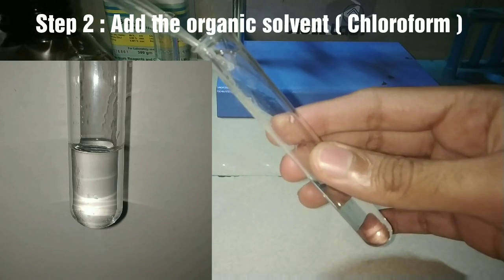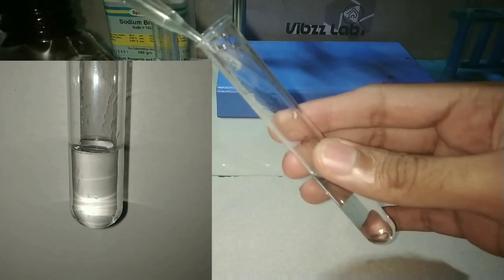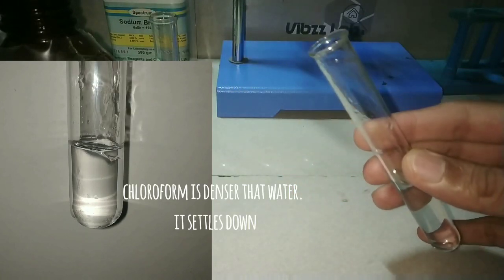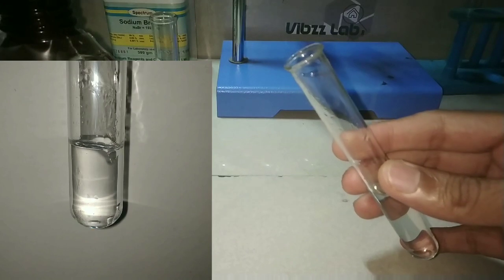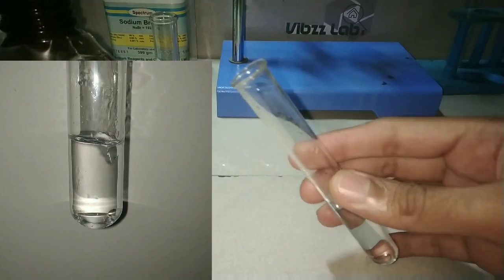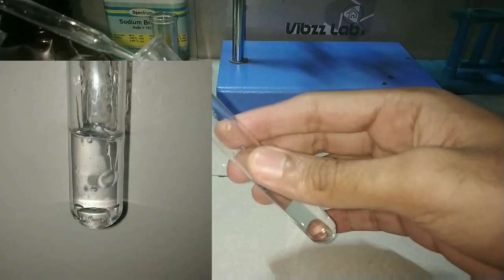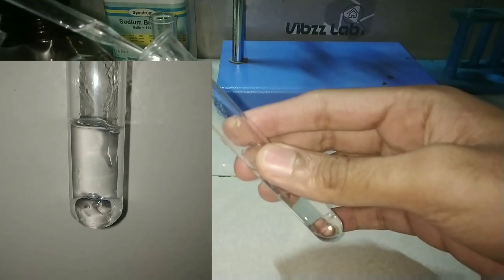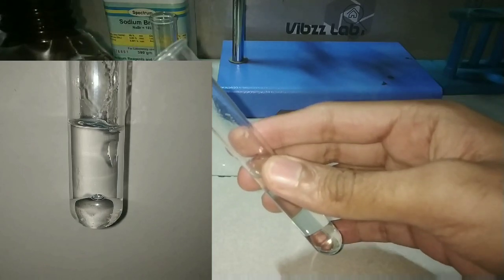Here I am using chloroform; you can also use carbon disulfide or carbon tetrachloride — both are good organic solvents which are heavier than water. You can see that when I am adding the chloroform, it is going under the water layer and forming a separate layer underneath because it is denser than water.